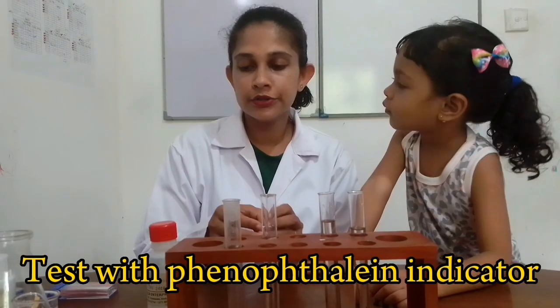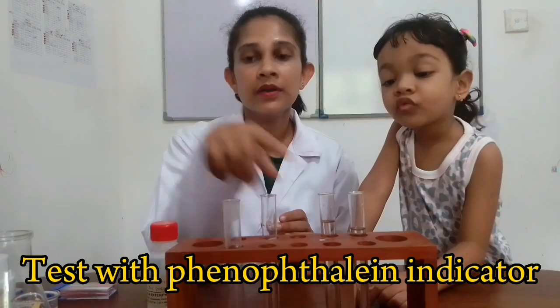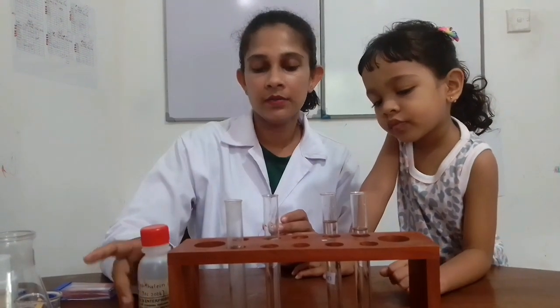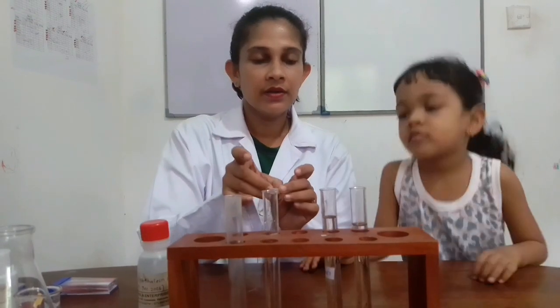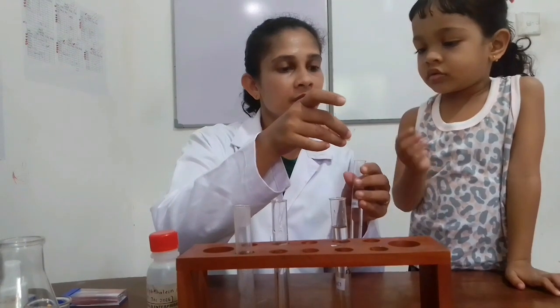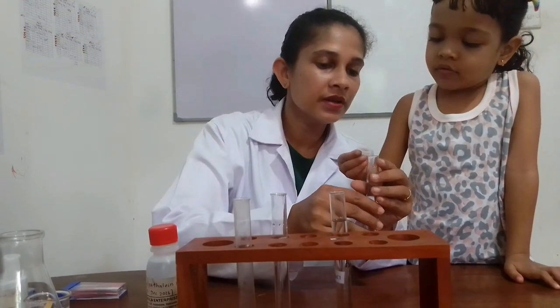Now I am going to check whether color change is there or not when you use phenolphthalein indicator. This is phenolphthalein indicator. I am going to add a few drops of phenolphthalein indicator into sodium hydroxide solution. Let's observe what happens. Do you want to add? Yes, into sodium hydroxide solution. Yes, you can add.